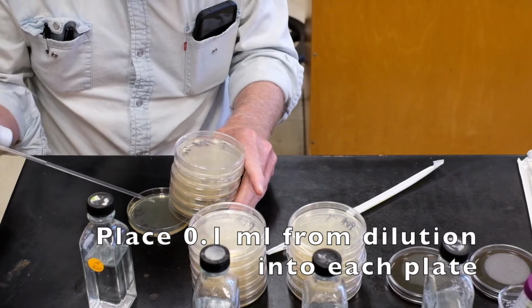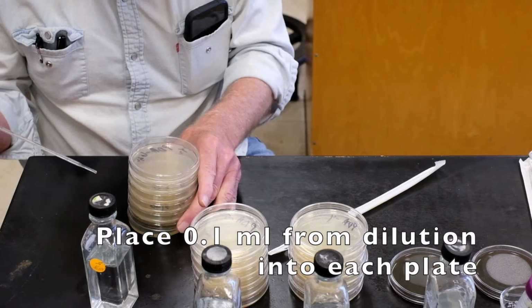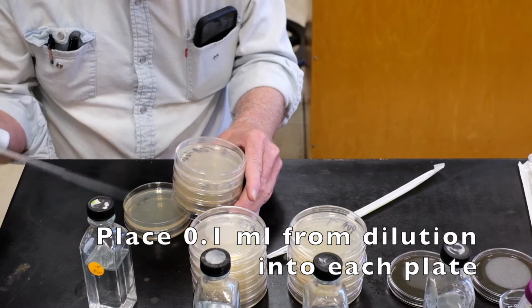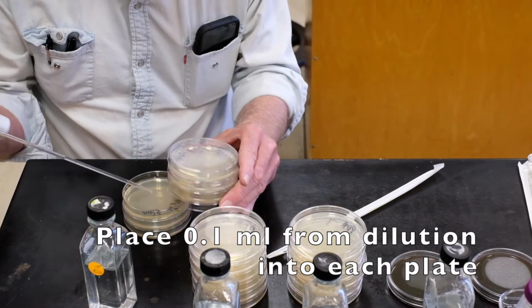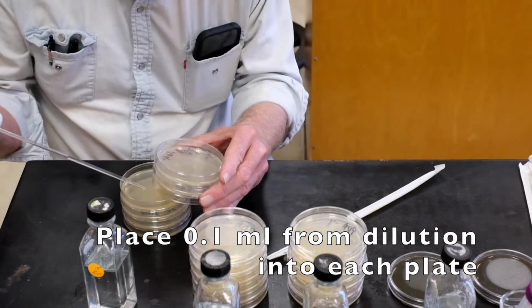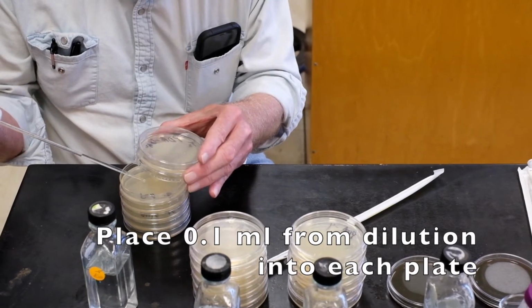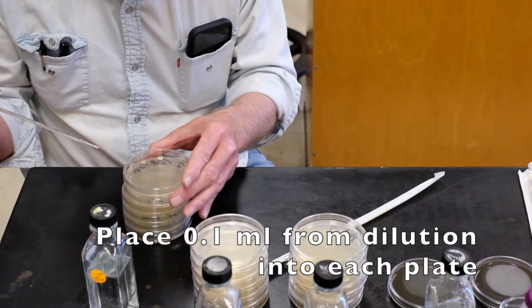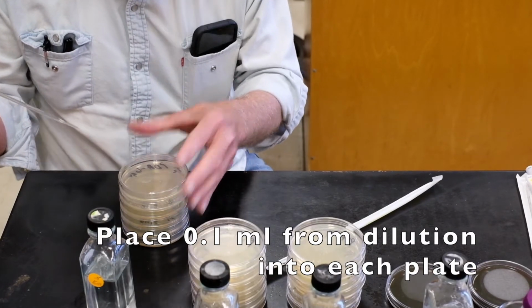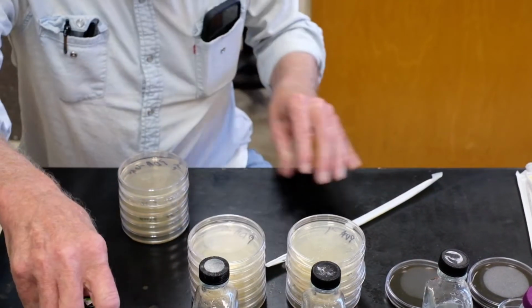I'm going to go from the top to the bottom. I'm putting 1/10 ml of that dilution. Now I've plated this dilution, and I'm through with this.